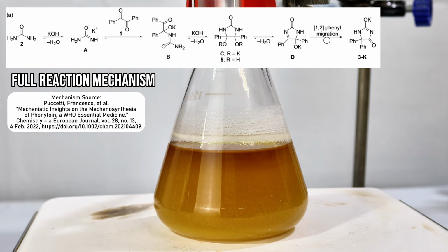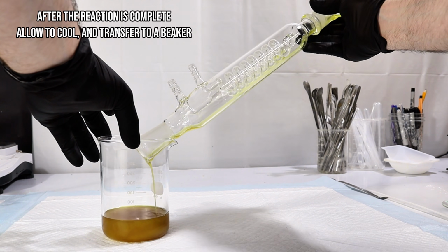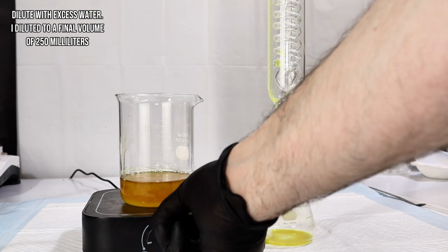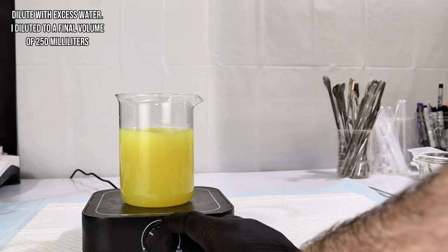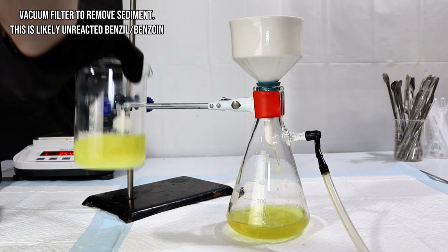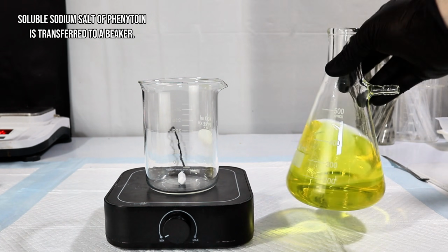After 2 full hours, no further color change was observed, and so I cut the heat and stopped the reaction. I then poured the mixture into a 400 milliliter beaker, and typically here you'd want to first remove the reflux condenser, but somehow it had fused to the flask. Anyway, the mixture was next diluted to around 250 milliliters using distilled water and then passed through my Buchner funnel. The sodium salt of phenytoin is very soluble in water, and so any precipitate would have to be either reaction byproducts or unreacted starting material.